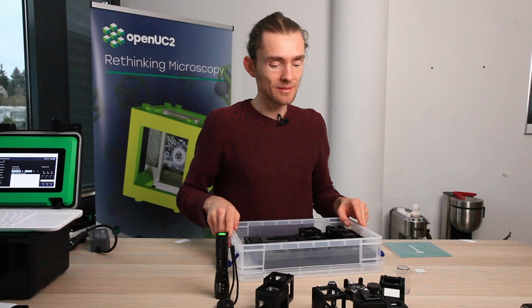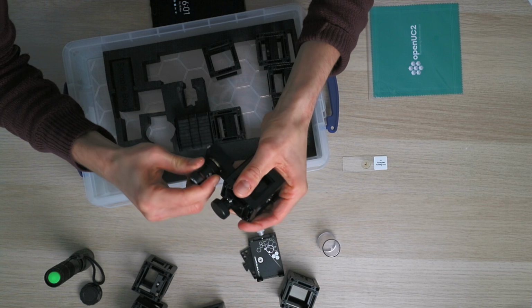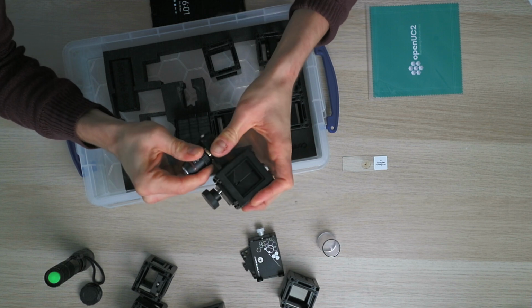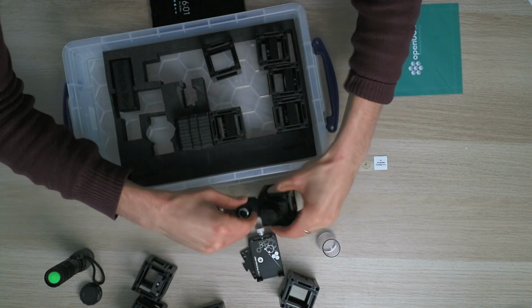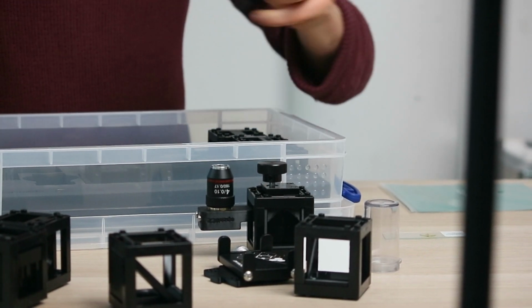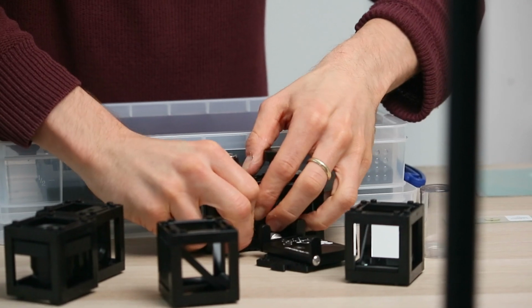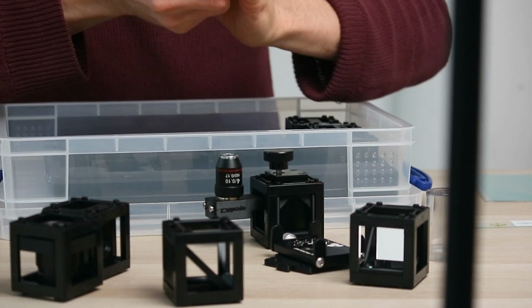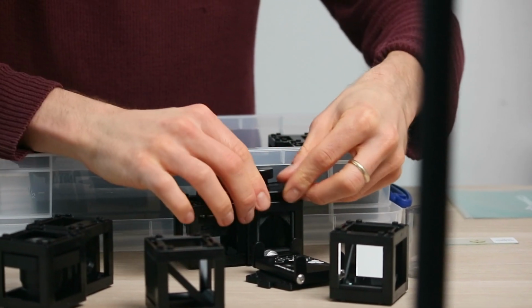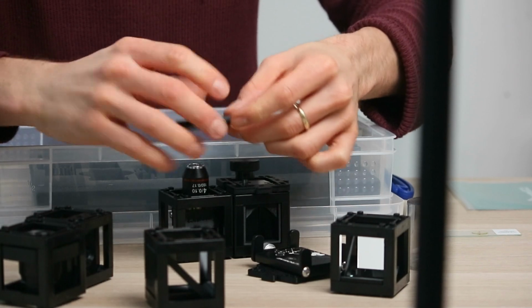And well, eventually also some more parts, but what's important is, well, let's first mount the objective lens. So you put that into the 3D printed threading. So sometimes it works just out of the box, sometimes it's a bit tricky. It doesn't matter so much. And then you need to put this into a cube. So you open this cube here, you close this, and then fix this whole thing with, well, we can maybe also do that like this. First close the cube and then sneak that inside and then fix it with the cube puzzle pieces.